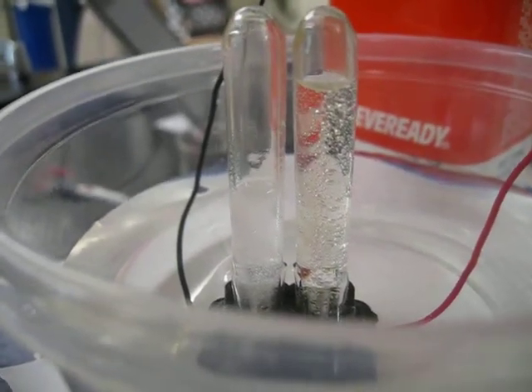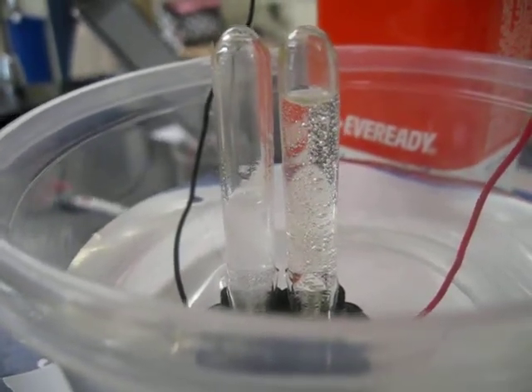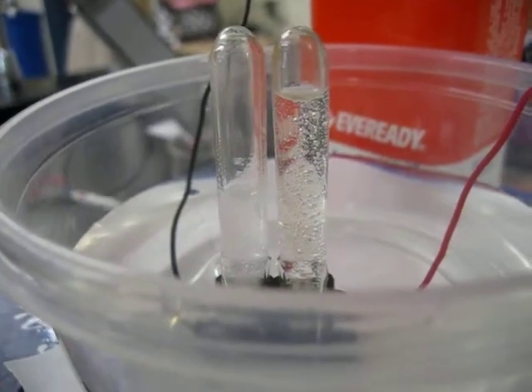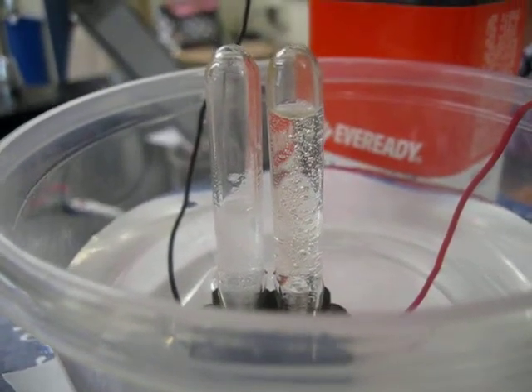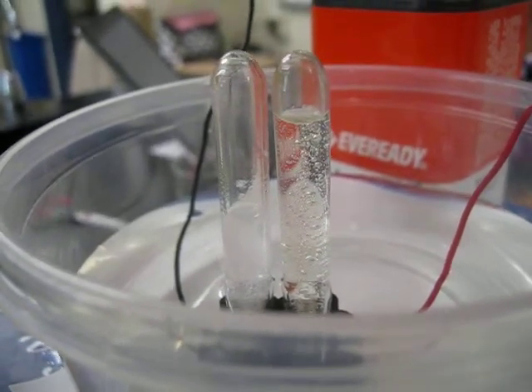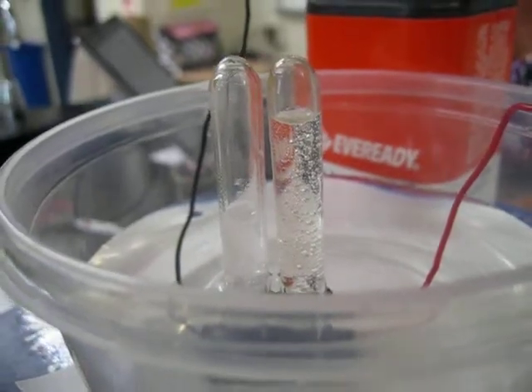After you have written down your observations for number 1 for what you see at the positive electrode and the negative electrode, you're going to answer number 2. What do you observe about the volumes of the two substances collected in the tubes? Now, we're not talking about the volume of the water. We're talking about the substances that are being collected that are taking the place of the water in the tubes. So take a look at that closely and then write your observations for number 2.